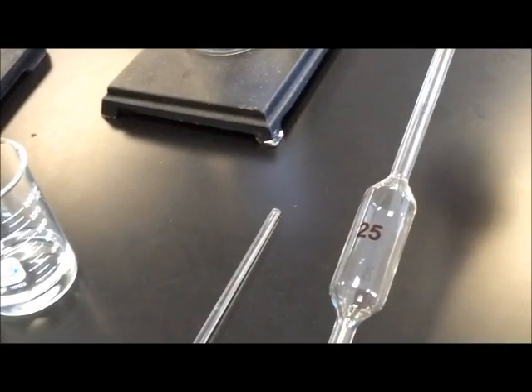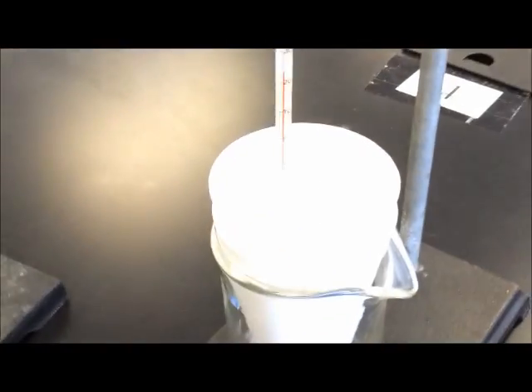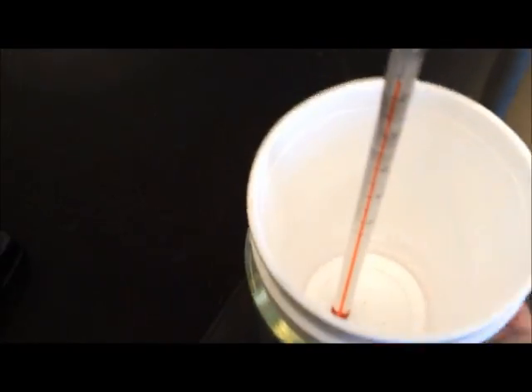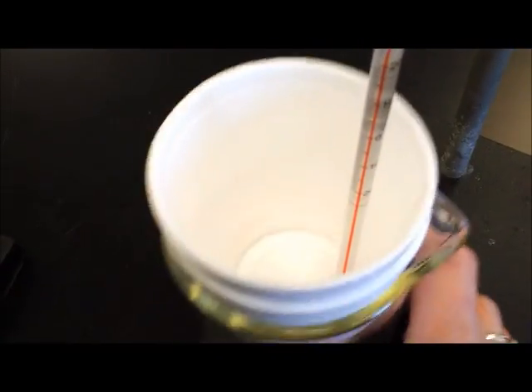we're going to transfer exactly 25 centimeters cubed of the base inside the styrofoam cup, and we are going to wait until the temperature stabilizes.